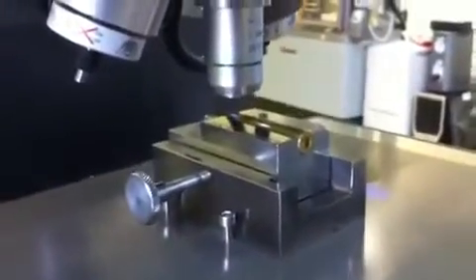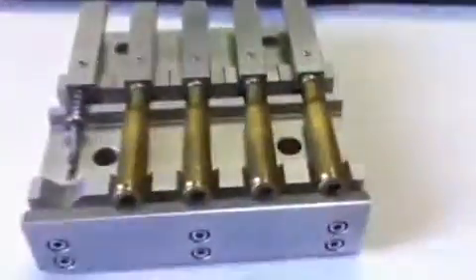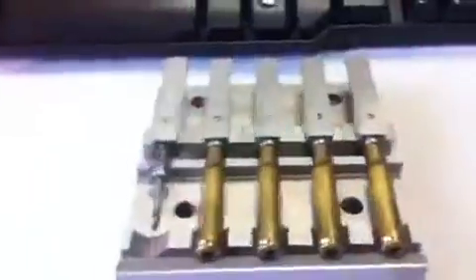We also have this custom bullet shell fixture which we have available. For this video I just used a single bullet shell fixture to get the idea of the changing height of the Z-axis. But what you could also do is use coordinates and mount this fixture on our XY table.